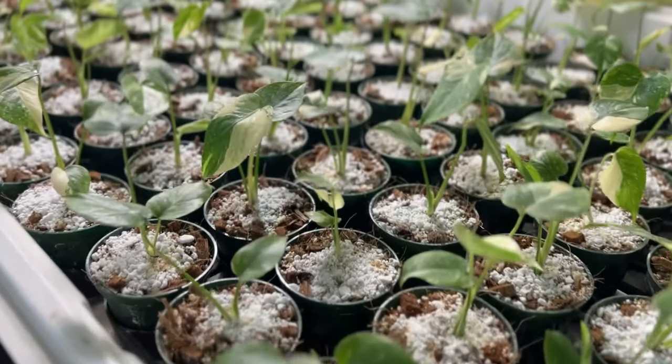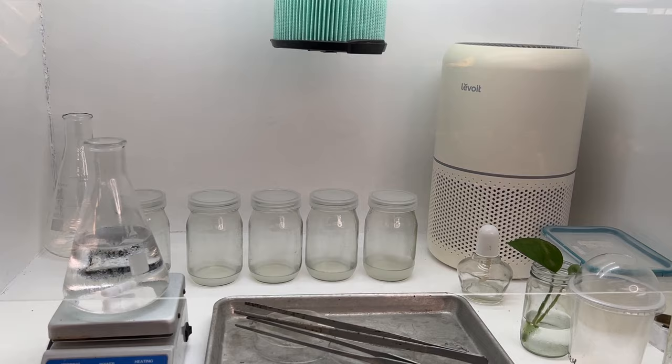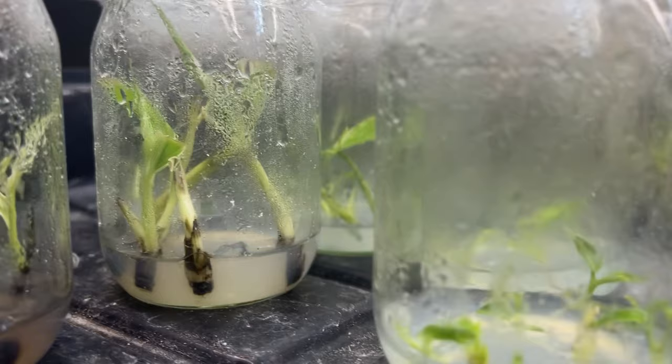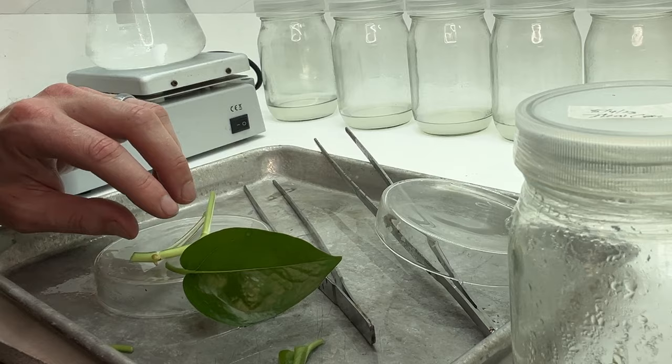Welcome to the world of tissue culture, a fascinating field of biotechnology that has changed the way that we grow plants. Tissue culture is a technique that cultivates plant cells in a controlled lab environment. It allows us to grow multiple plants from small singular pieces of plants, expediting the plant production process compared to traditional methods of seed and cutting propagation. A more apt name for the field is micropropagation, since the same concepts are used in typical asexual propagation methods.